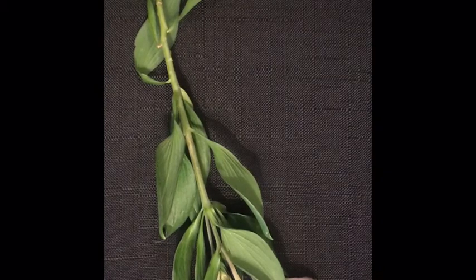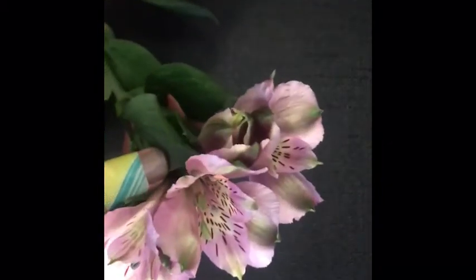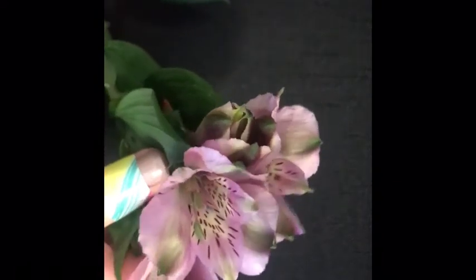So we are going to start, this is called an alstroemeria, and I was at Trader Joe's getting food yesterday, and I found these at the store. I was really surprised to find more flowers, but I grabbed them because these are great flowers to be able to see its different parts. They're very clear. So we are going to talk all about this flower, and we're going to talk about all of its parts and how they reproduce.